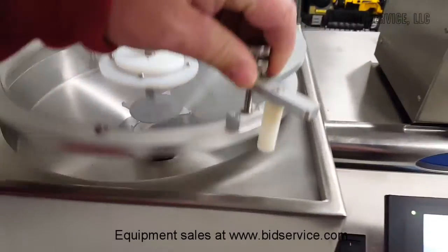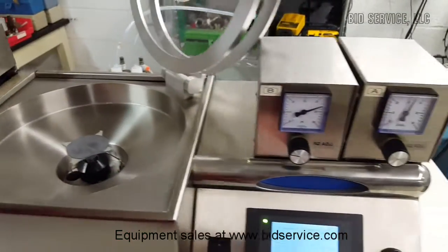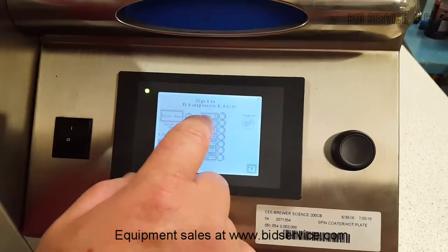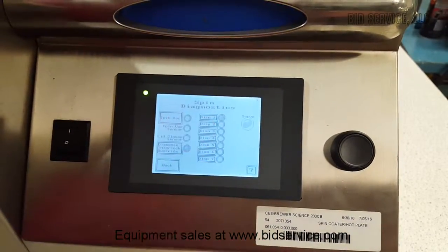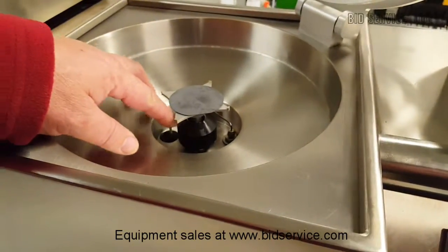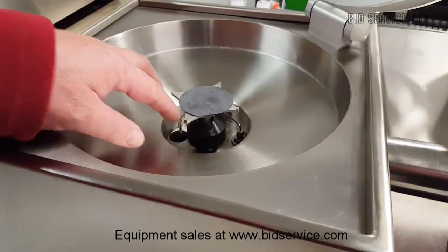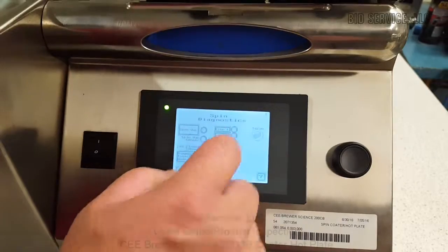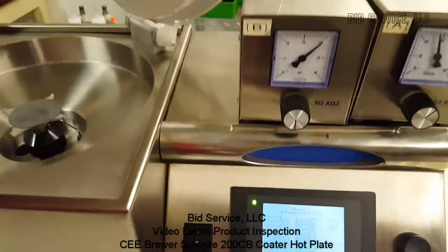The other thing I can show you is going to diagnostics. I'm just going to go through a couple of dispensers to show you that dispense one is your bead. You can see I can put my finger on the end of the bead removal for it. Now I'm going to shut that one off, and then I'm going to hit dispense two, which is the photoresist, which is up here.